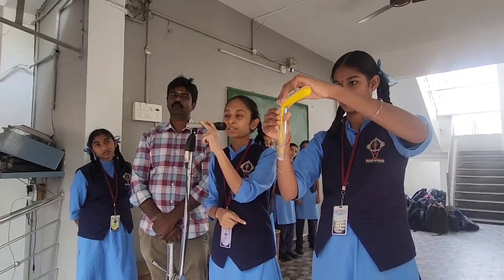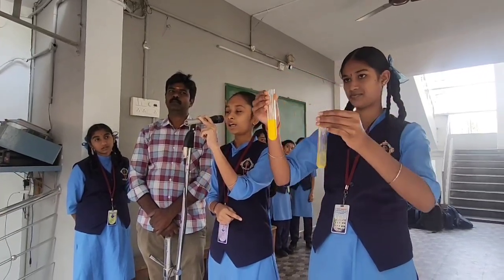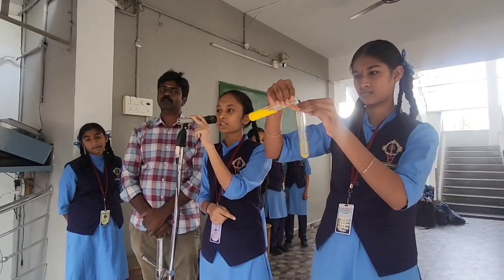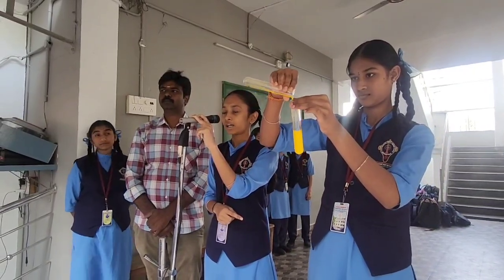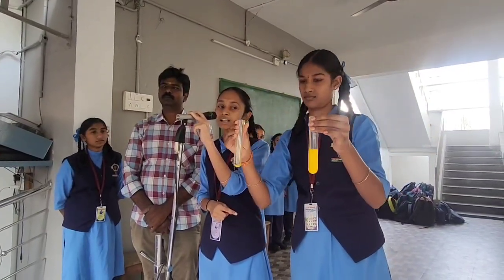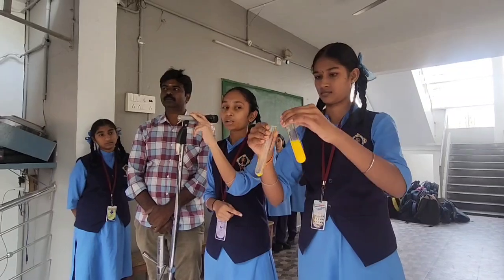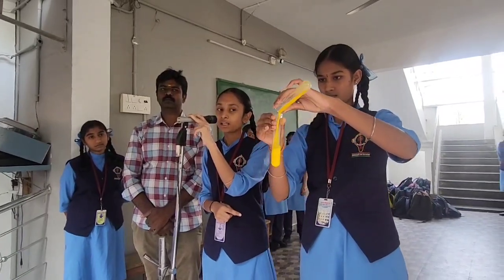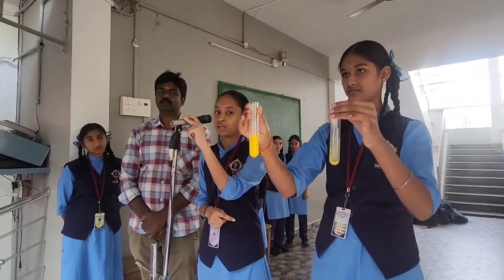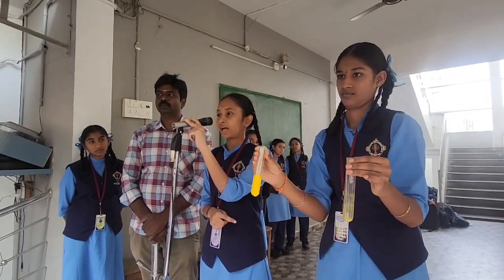A yellow colour precipitate was formed which is called lead iodide. Due to the reaction between the potassium iodide and lead nitrate, they exchange ions to form a yellow colour precipitate — lead iodide and potassium nitrate. This is a double displacement reaction.